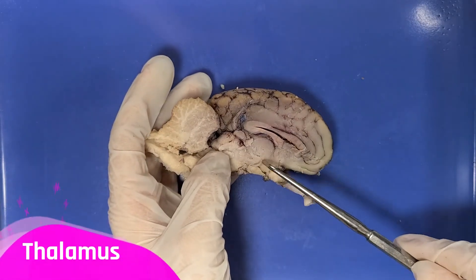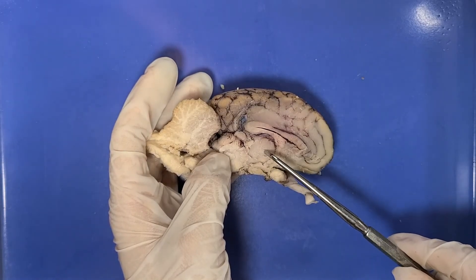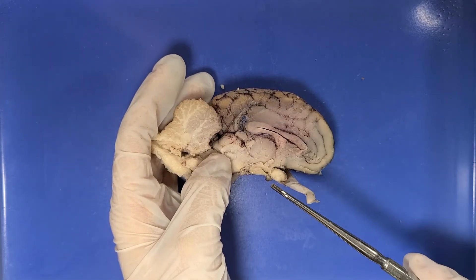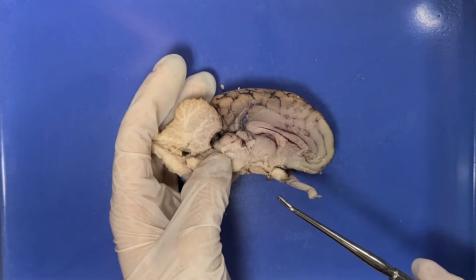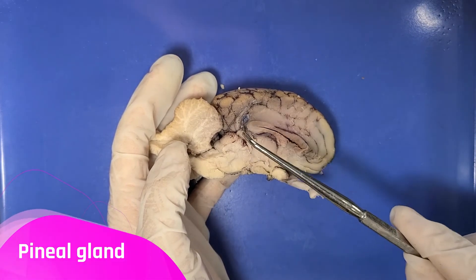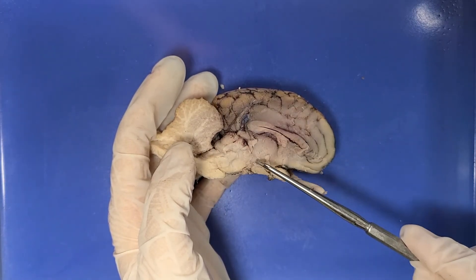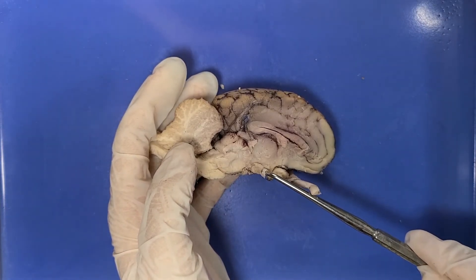This circular tissue is the thalamus, which acts as a relay station. When the body registers a sensory impulse, it first travels to the thalamus, which then passes it on to the cerebral cortex for interpretation as touch, pain, or temperature. 98% of sensory information passes through the thalamus — the only exception being information related to smell, or olfactory information. This smaller circle here is the pineal gland, which regulates circadian rhythm and produces melatonin to control sleep cycles. This region below the thalamus is called the hypothalamus, which serves as the link between the nervous and endocrine systems and is involved in a lot of hormone control.